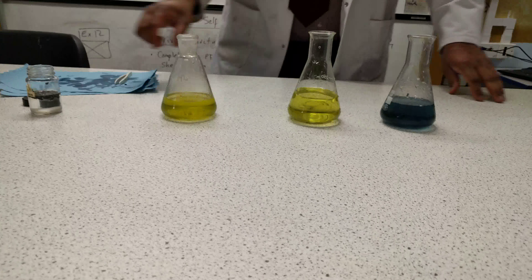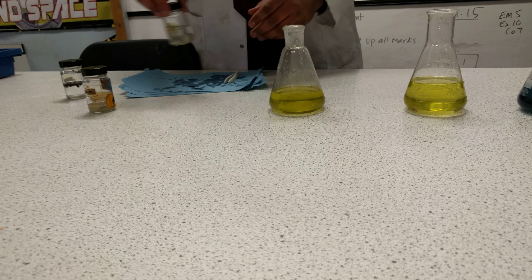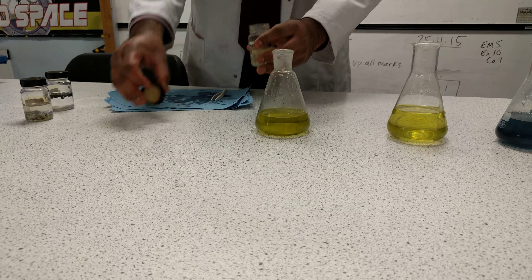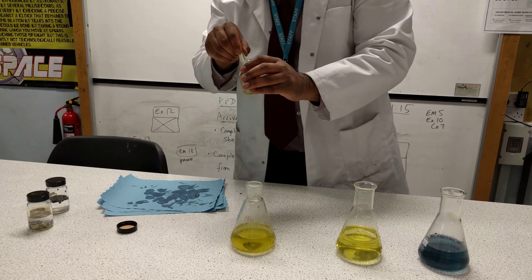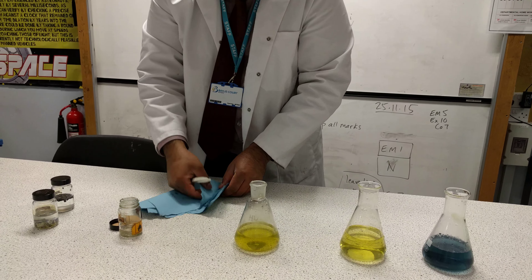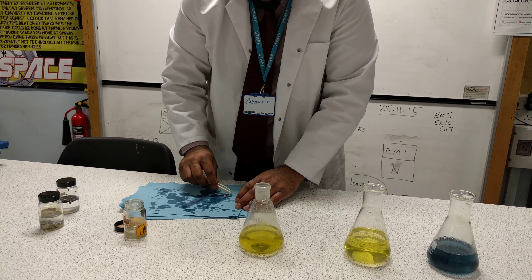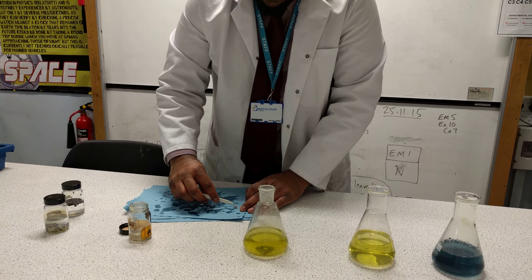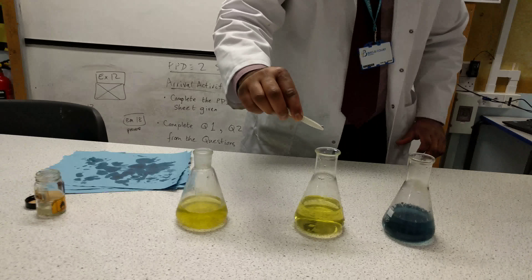The next metal I'm going to take is sodium. Note that sodium is lower than lithium in the group, so as you go down the group the metals become more reactive. I'll take some nice pieces of sodium and make sure to dab them on some tissue paper to get all the oil out, because we don't want it to slow down the reaction. I'm going to grab both pieces together and drop them into the water.